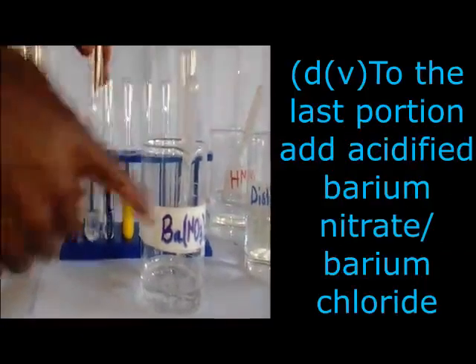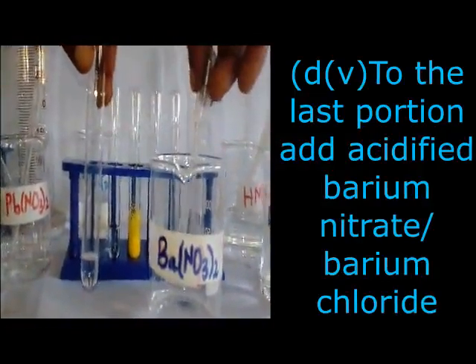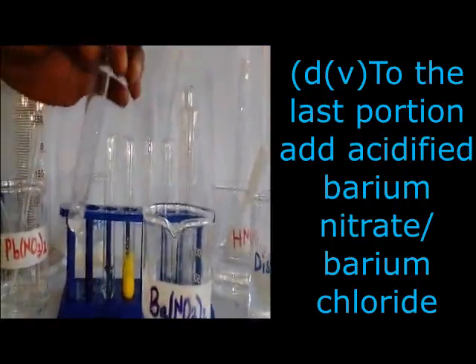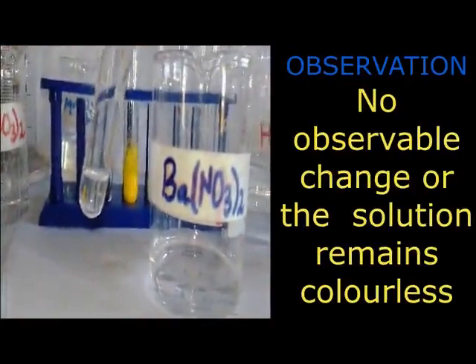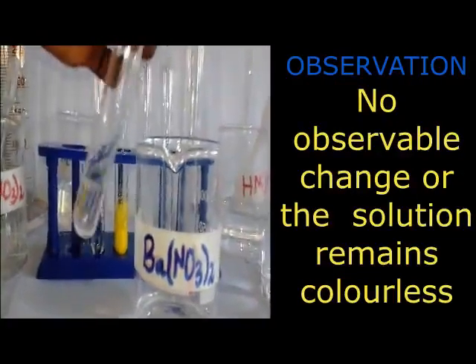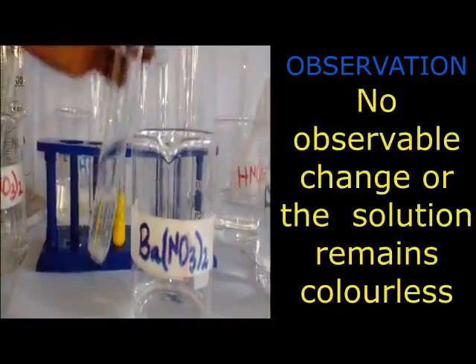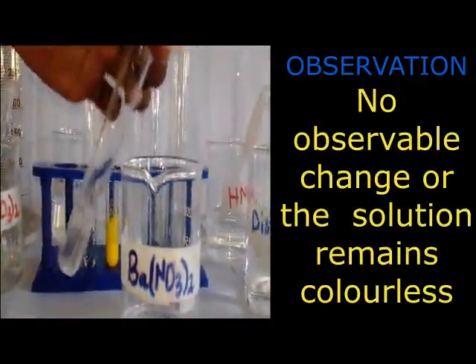Then we continue to confirm whether the sulfate and the chloride are absent by adding barium nitrate and nitric acid. We can even add barium chloride and hydrochloric acid. I go to my barium nitrate reagent. Now I am adding it to my test solution. Remember, these are the test solutions on which we divided. You can now see no observable change.